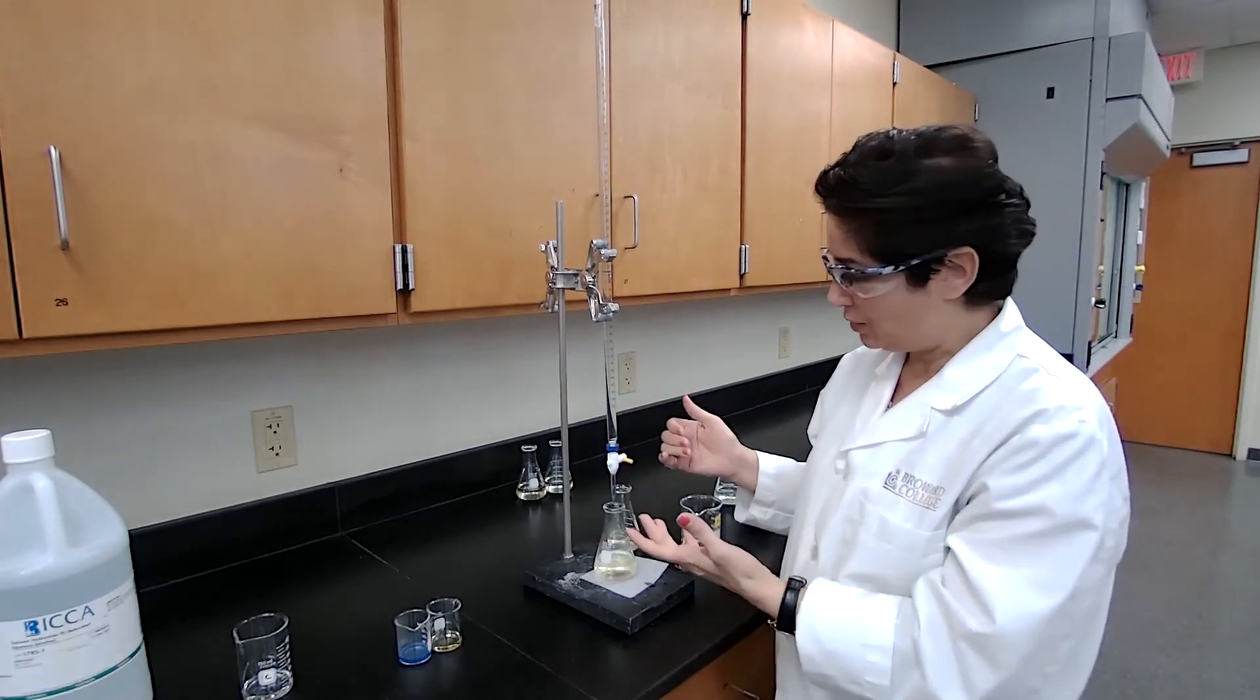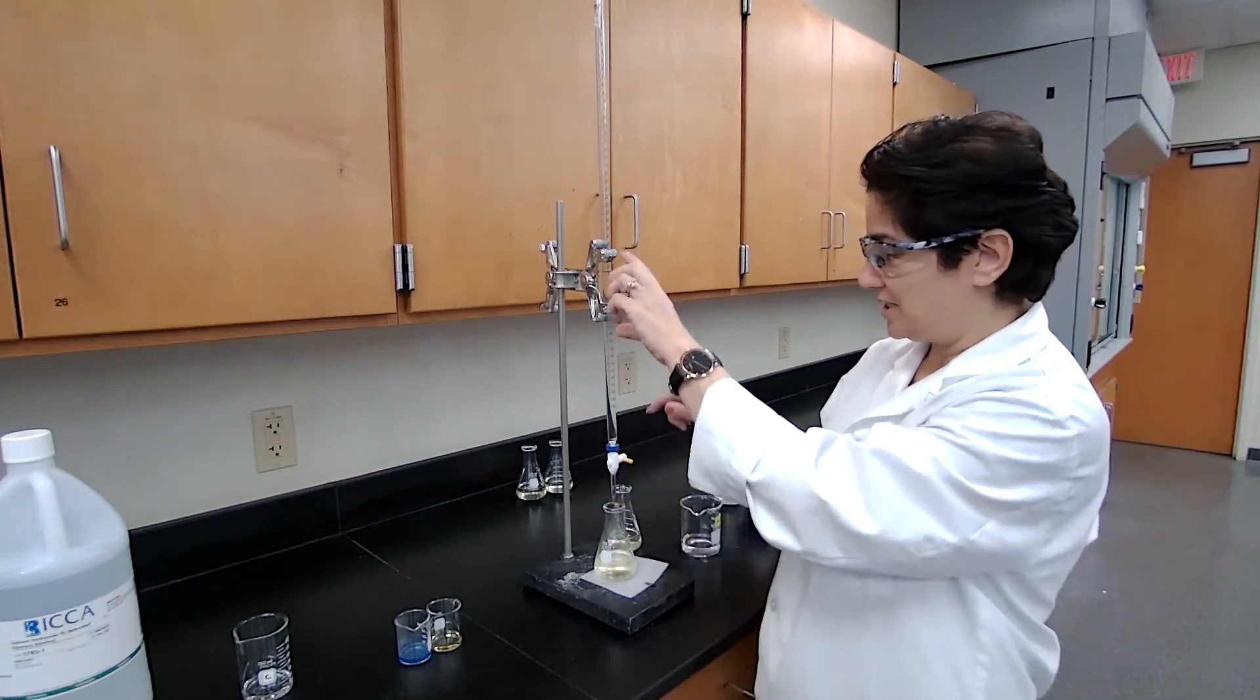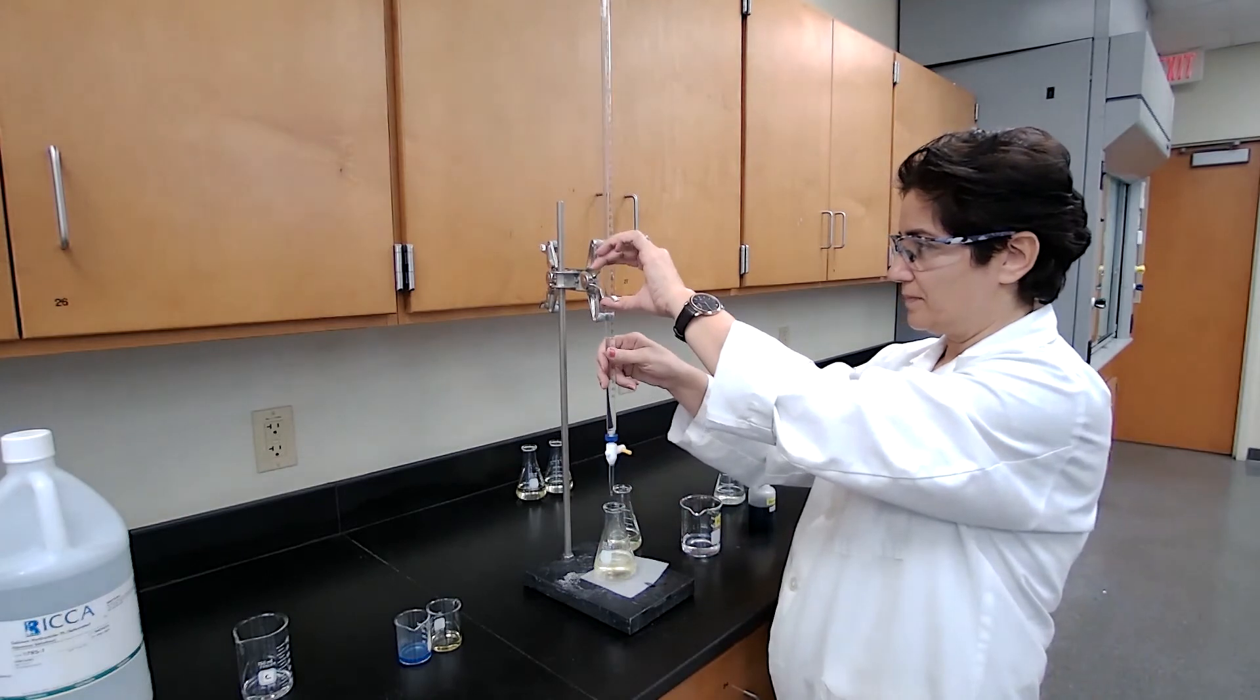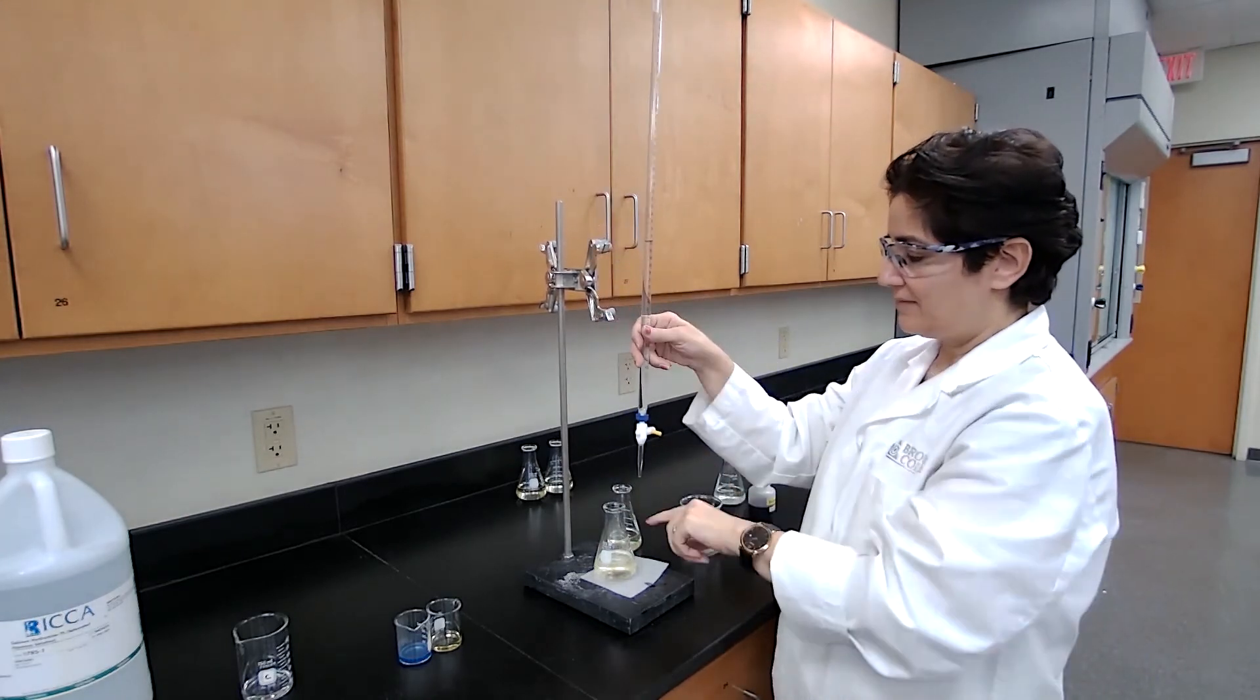So last drop we add slowly. And as soon as the color change is constant for 20 seconds, then we can stop.